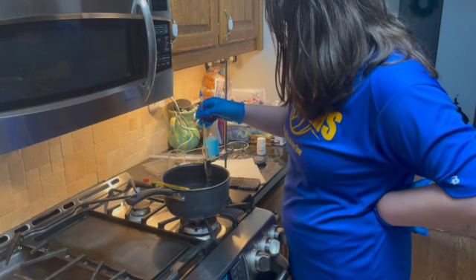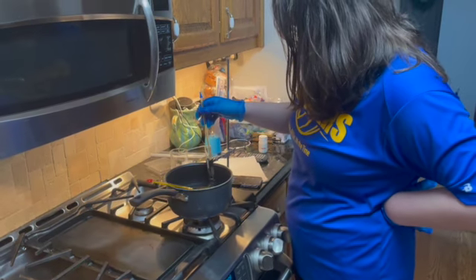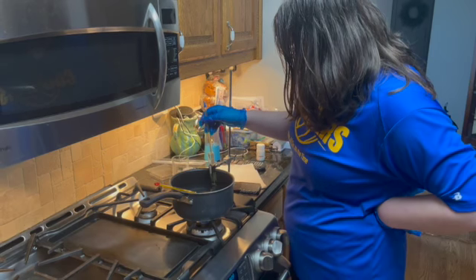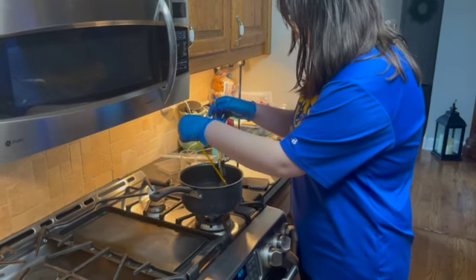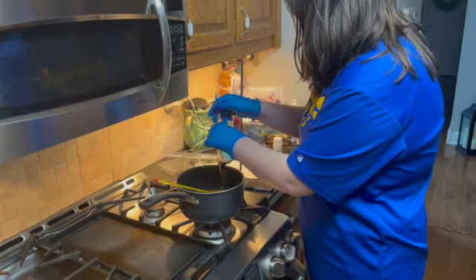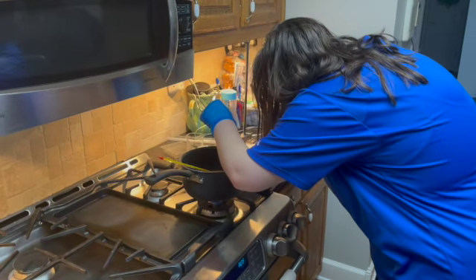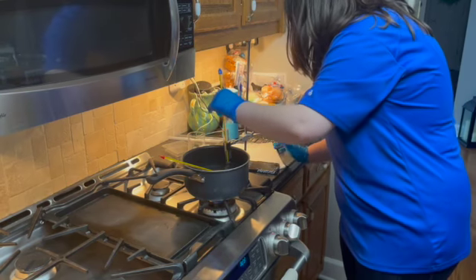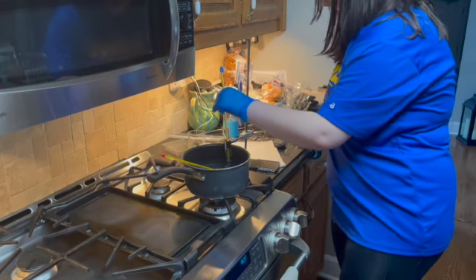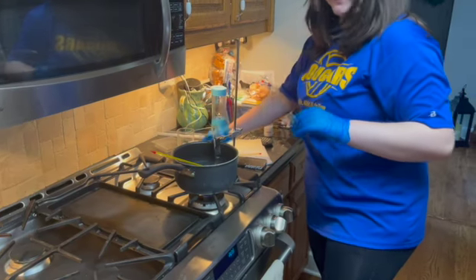We are at our 4 minute mark, and it looks like for 4 minutes our solution is at 55 degrees Celsius, and our hot bath is at 55 as well. So they are roughly at the same temperature right now. And let me just make sure. And this is where I stop at 4 minutes and 16 seconds. The naphthalene mixture with paradichlorobenzene has completely melted through.